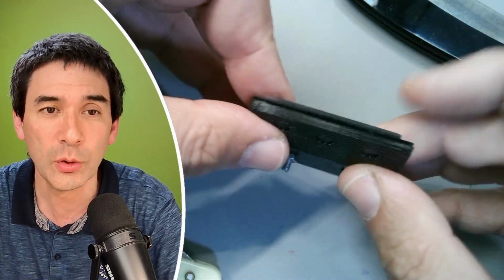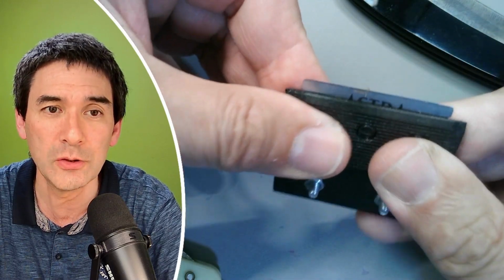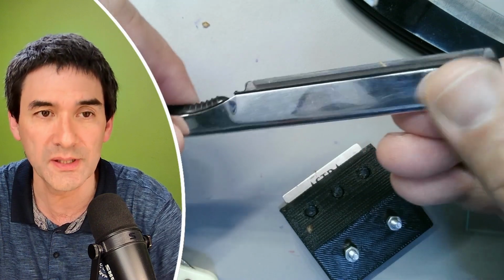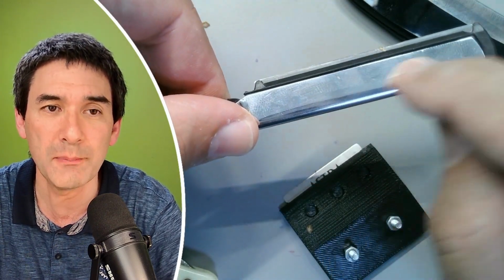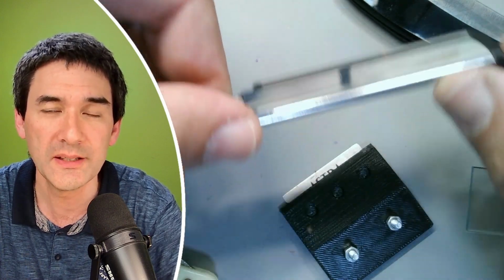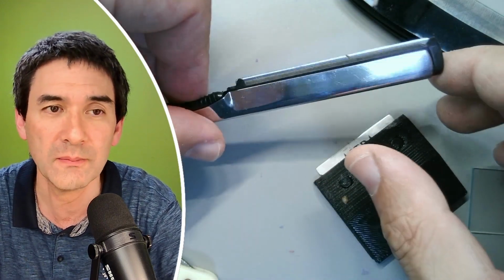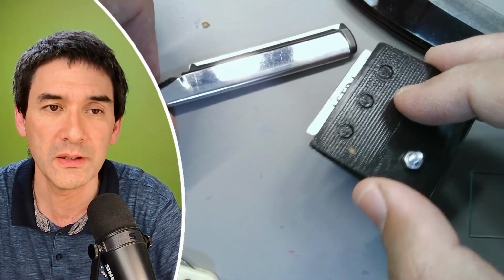Now, the blade holder, the 3D printed one, is quite important, because otherwise the blade itself would be too flexible, right? And that is actually also the reason why I chose this one over here. I have to be careful that I don't cut myself. Even though the blade itself is flexible, because it is basically inserted in here, it's still very rigid now. And this gives you also more consistent cuts. So my suggestion would be indeed to experiment around with disposable blades.